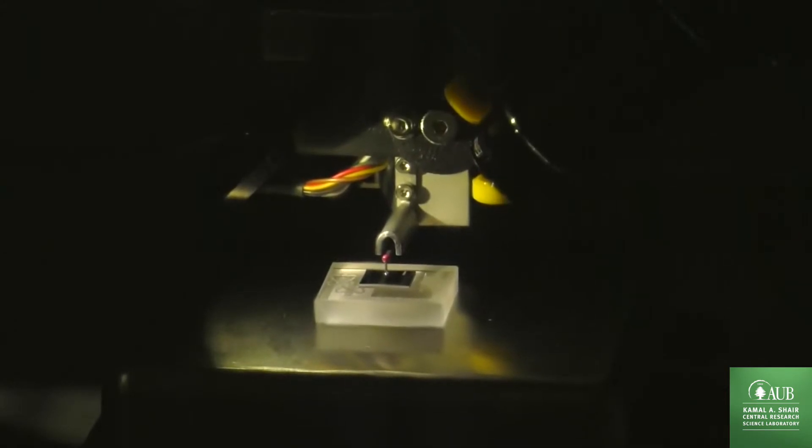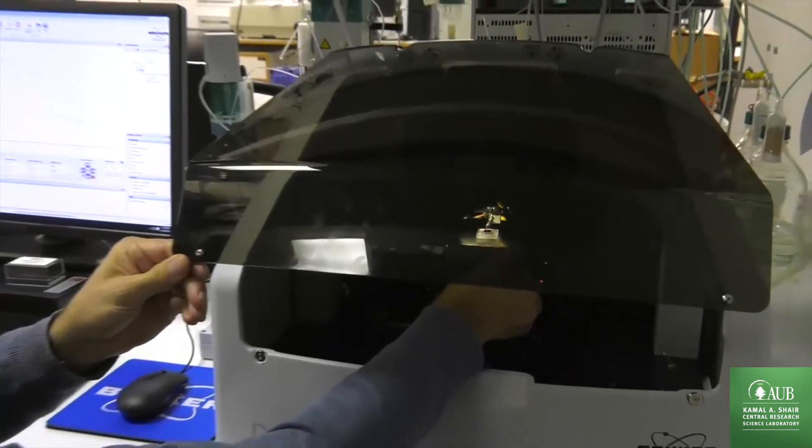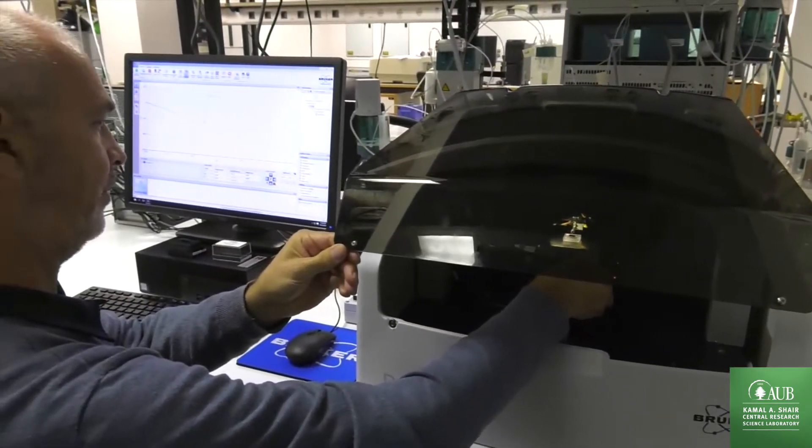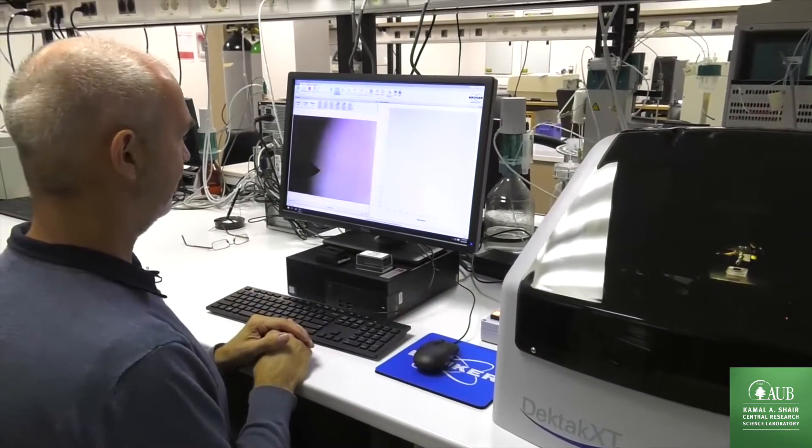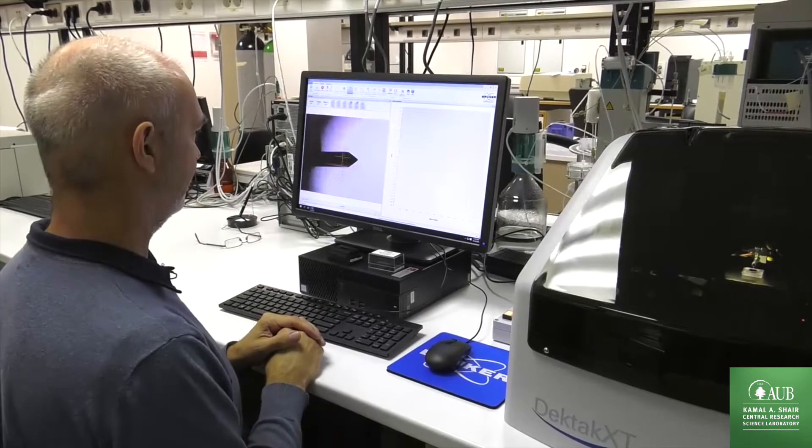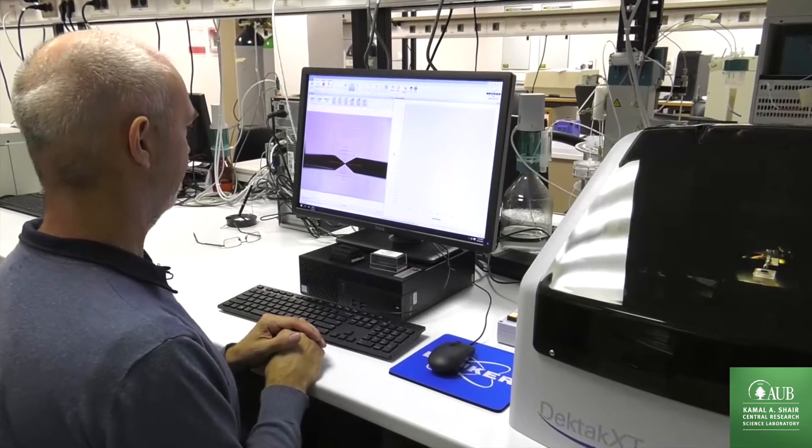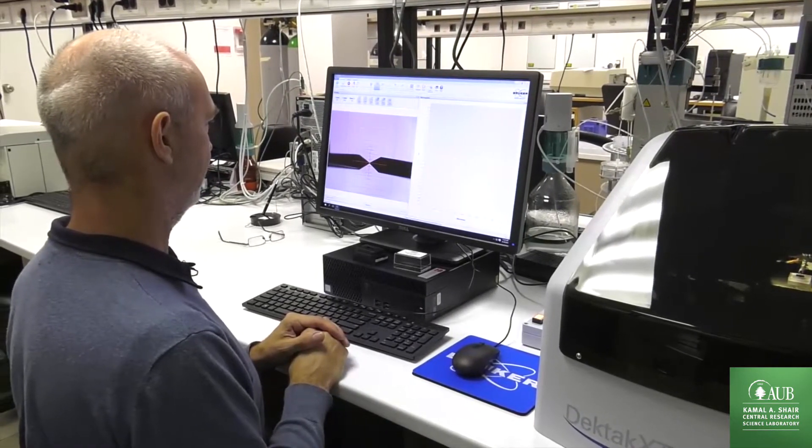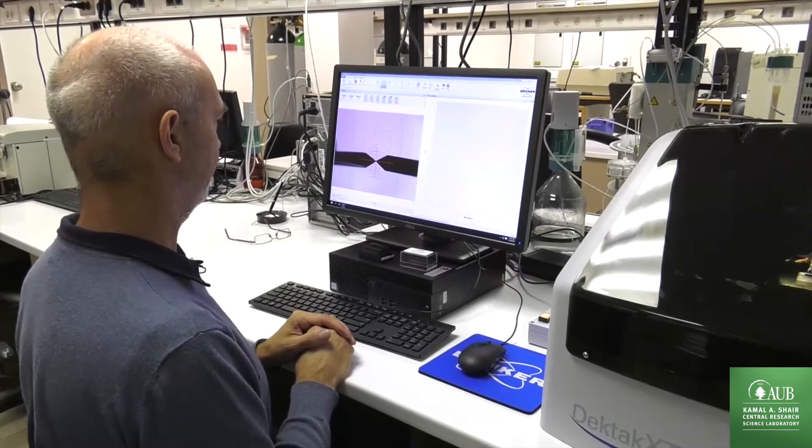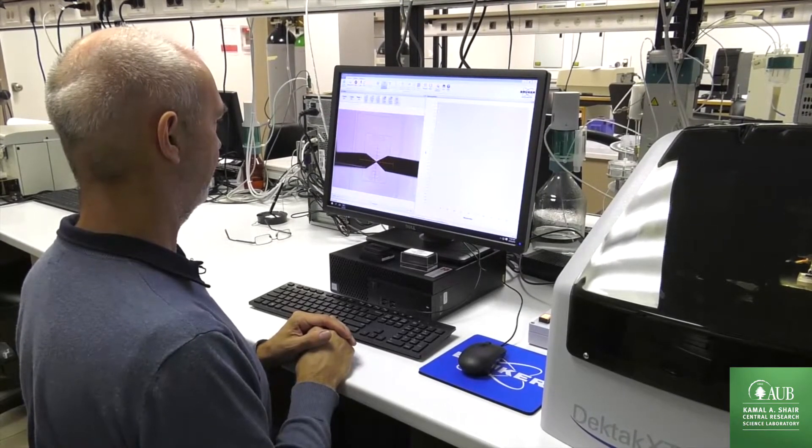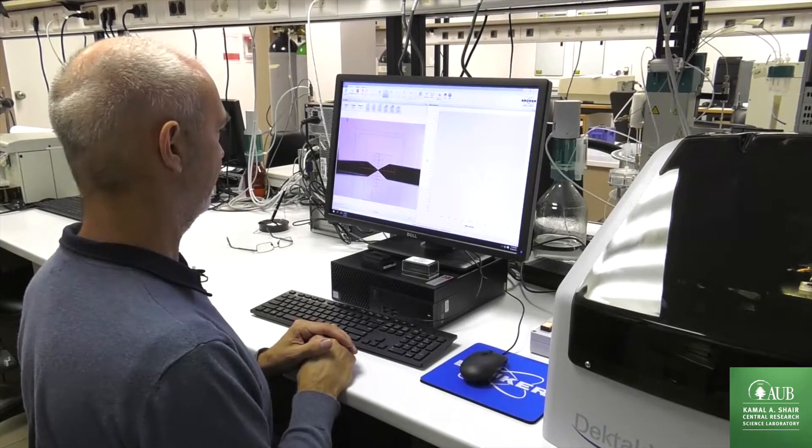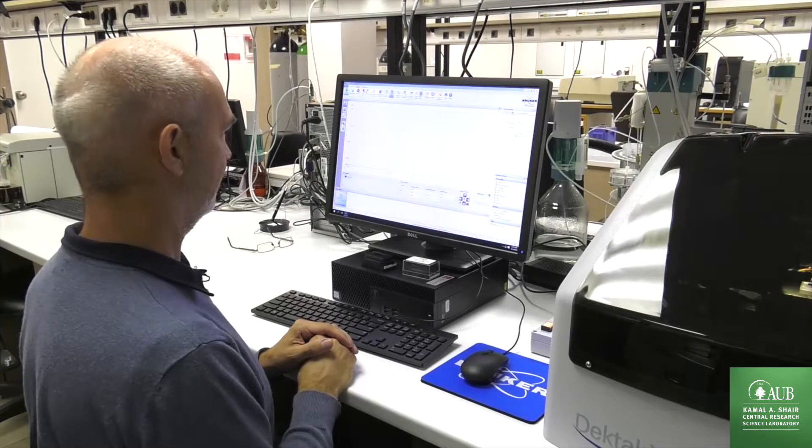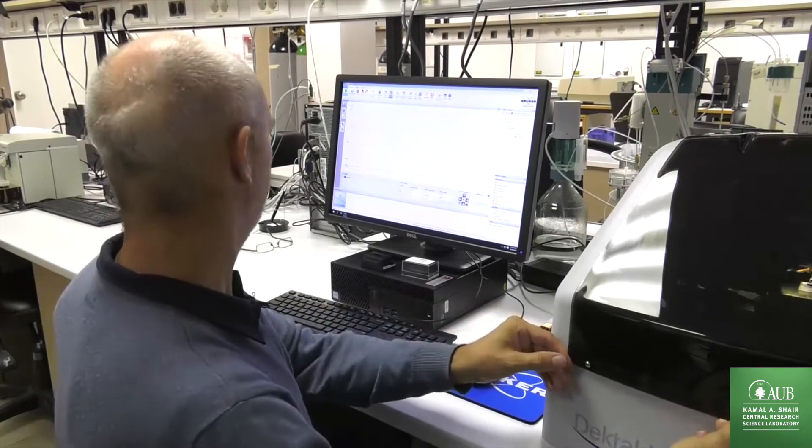We have a tilt of 1000 nanometer. Check again. There is no effect.